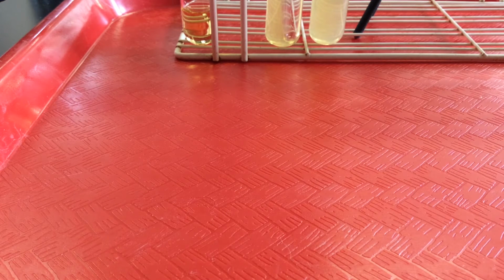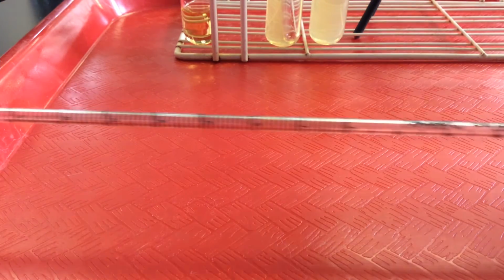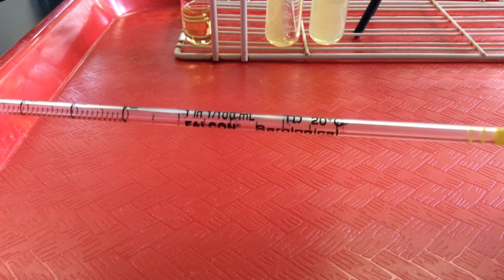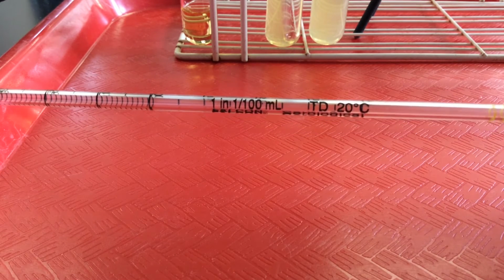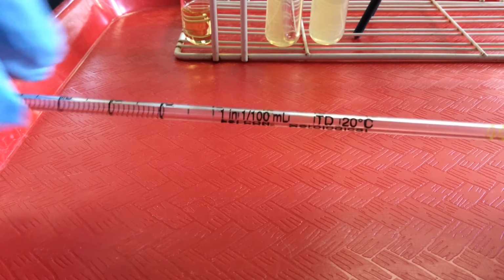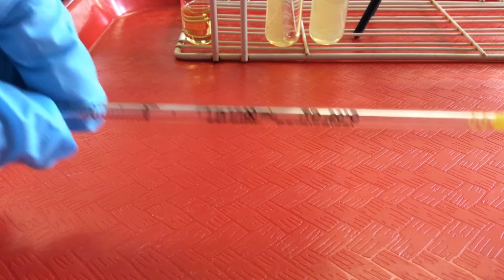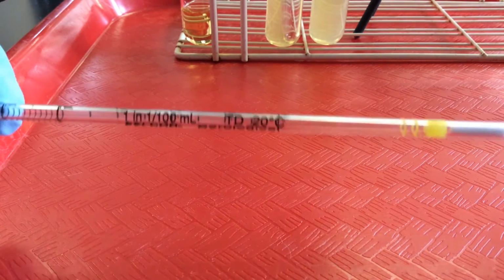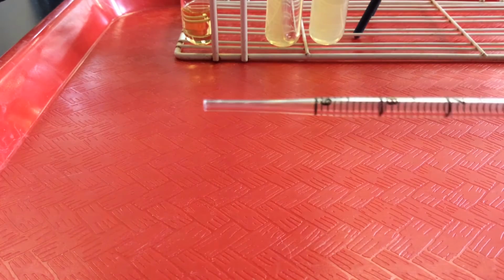Another way to transfer bacteria or to transfer liquids of any type is with the use of serological pipettes. And it's really important that we're familiar with how to read units on serological pipettes. They come in different sizes, and it's important to know how to read the serological pipette. So you'll see at the blunt end at this point, it has a cotton plug there to prevent aspiration of fluids. Okay, and then there's a tapered end down here.